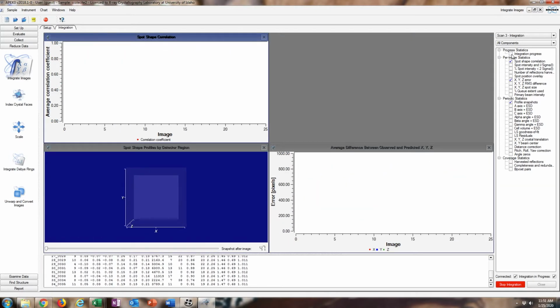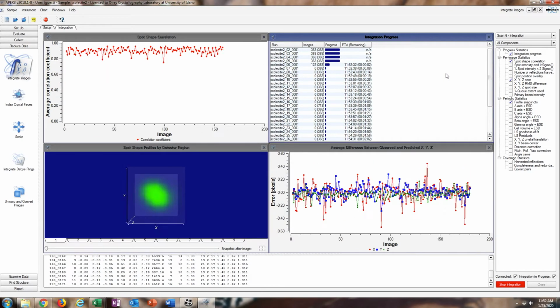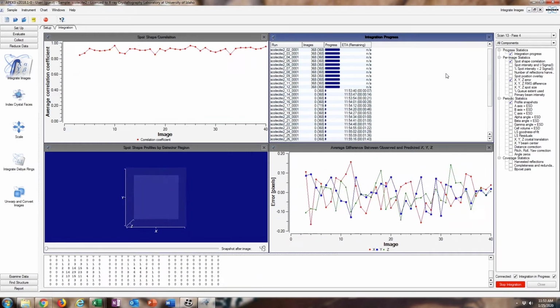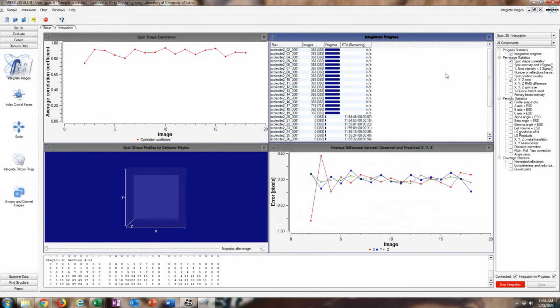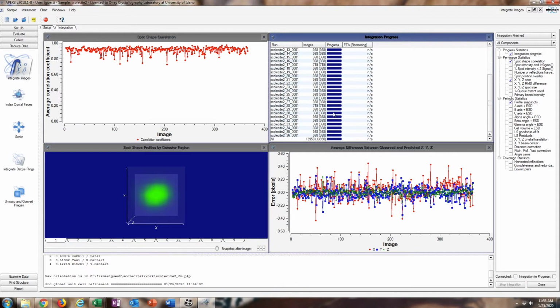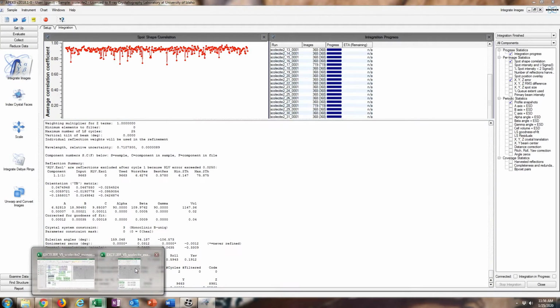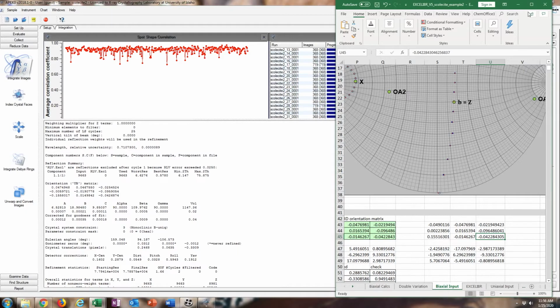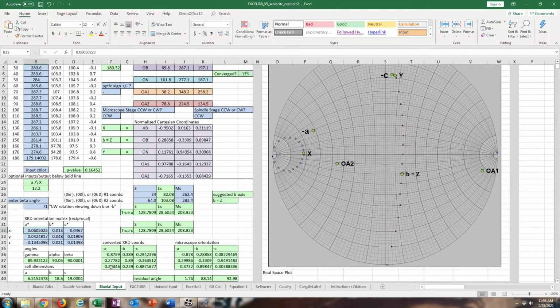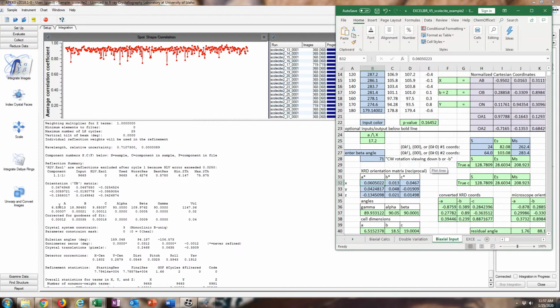In the upper right, I usually just close this one and open up the integration progress. Pixel error down below. So this is going pretty well because we have really good, high correlation coefficients for each of these. So we know that it found probably at least a usable crystallographic lattice. If it didn't, then these statistics would be really low and very high error. And that's done, and it kind of freezes up. But we can expand this window and look at our optimized orientation matrix. We can enter that into our orientation matrix on the spreadsheet if you're still wanting to deal with this, just so that you have a good plot of where the optical vectors and the crystallographic vectors are.